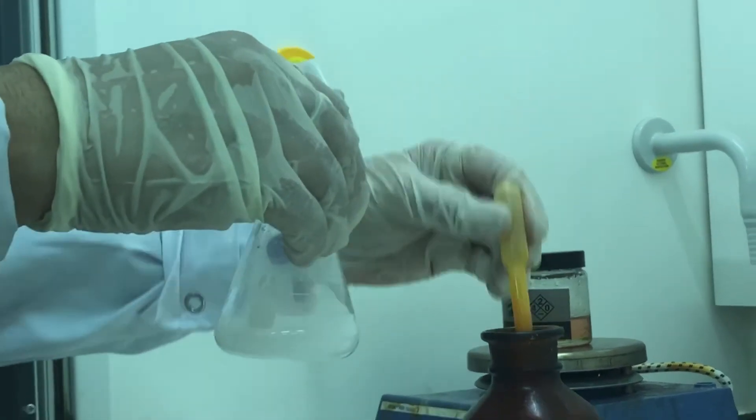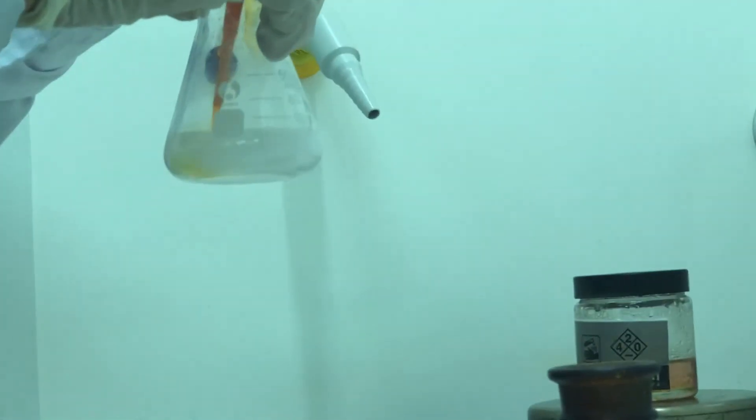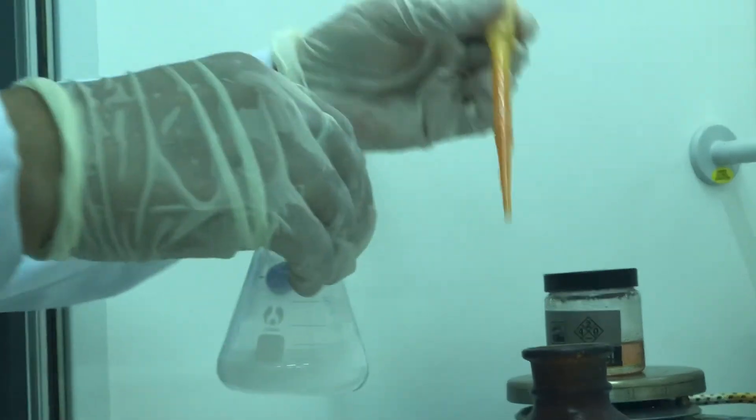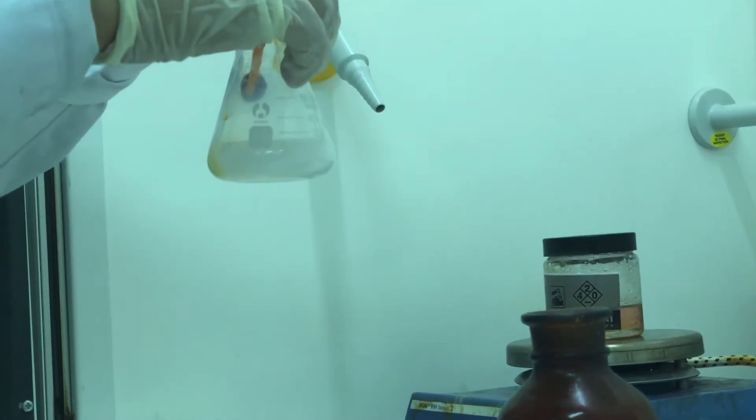Yes, as you can see now a white precipitate is formed, but still I don't find the brown color remaining inside, it's disappearing.